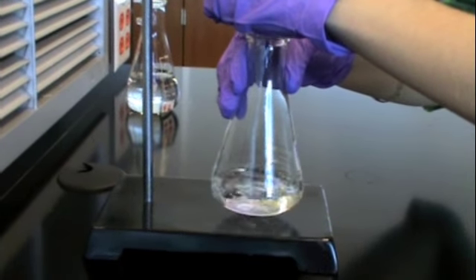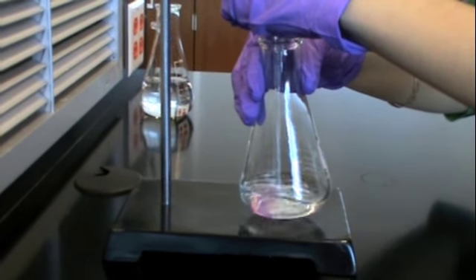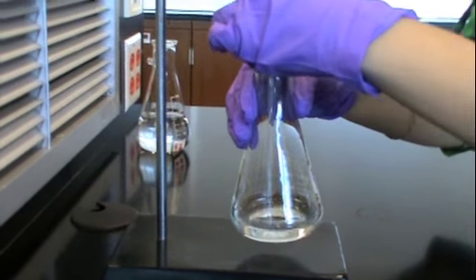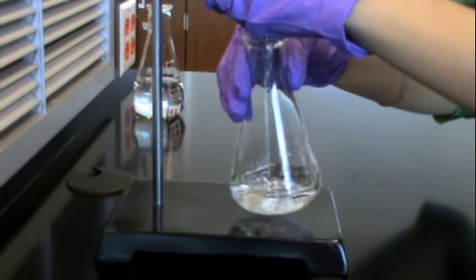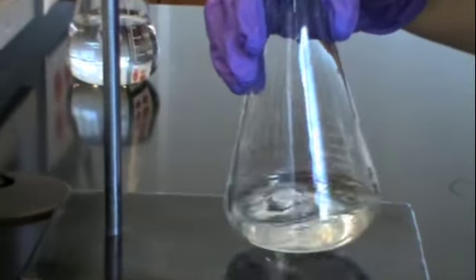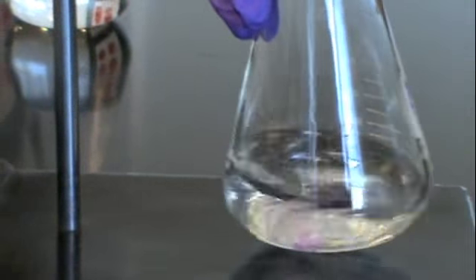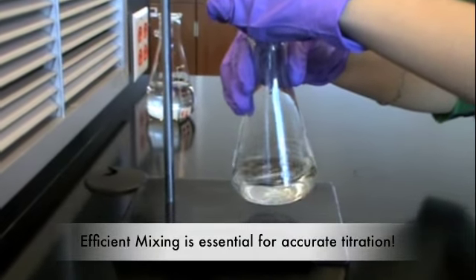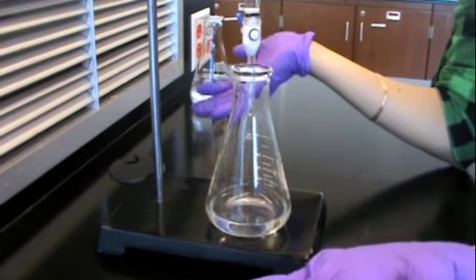When you're beginning to do the titration, make sure that you go in intervals of 1 to 2 milliliters. Notice that when the titrant inside the burette touches the KHP, it turns a faint color and fades away quickly. Make sure that you mix the Erlenmeyer flask well. And how do I know when to stop? When is the titration complete?